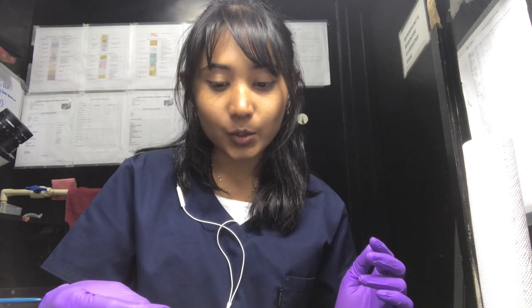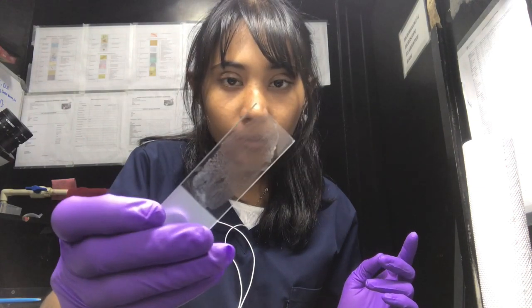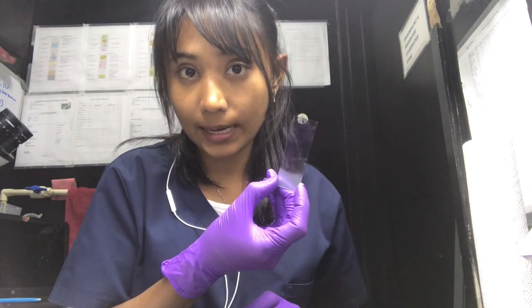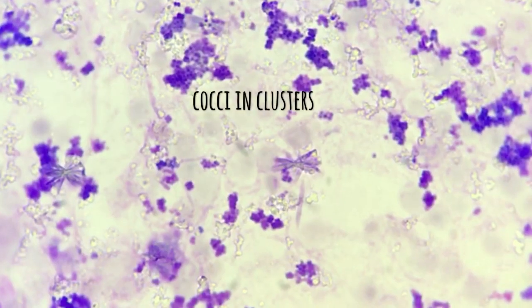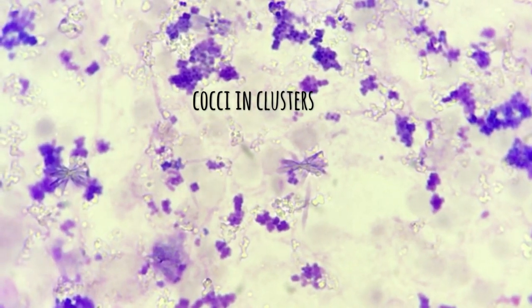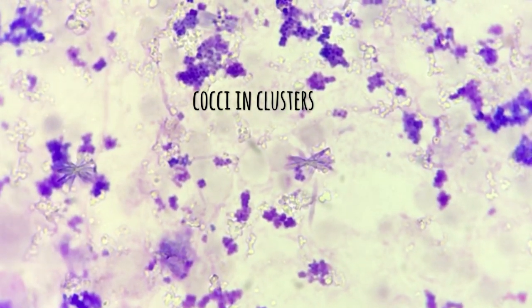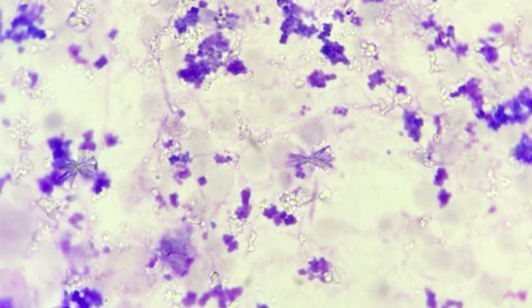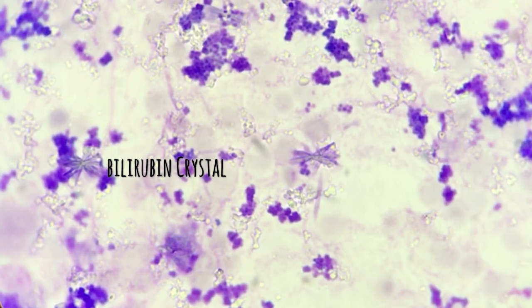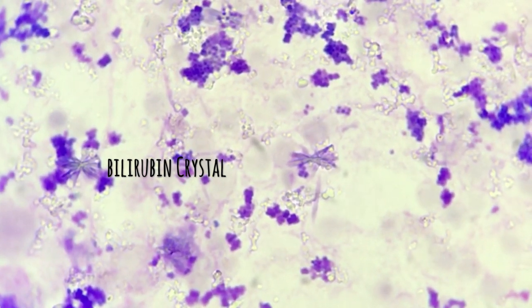We just saw direct microscopy and it really had a lot of interesting things. My slide is clean and dry now — let's stain it with Dip-Quick. After washing and drying, this is how the cytology looks: I see a lot of cocci bacteria in clusters, and you can see a star-shaped crystal in the center. It is a bilirubin crystal, which is mostly seen in liver diseases and hemolytic conditions.